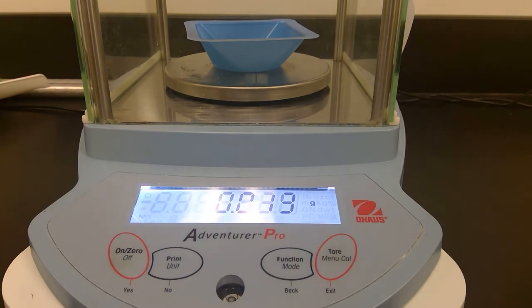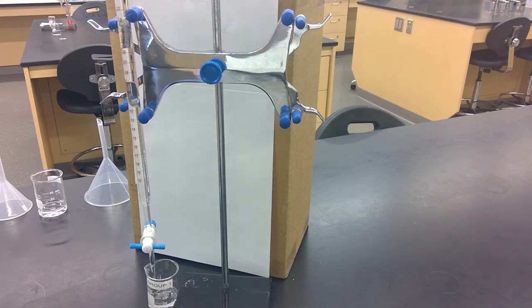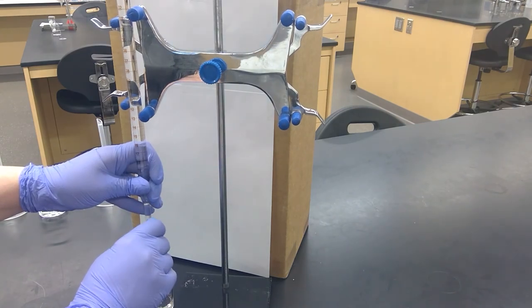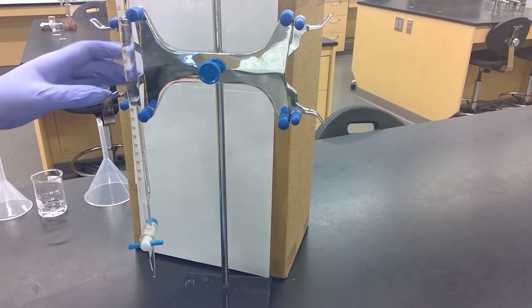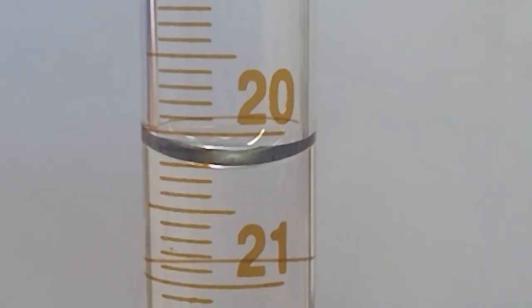Now we have three data points. We'll do this two more times. We're a little past 16 mils, so we'll want to go to about 20 to make sure we get more than three mils. Now I will have you record the final volume on your burette. Record the final volume.